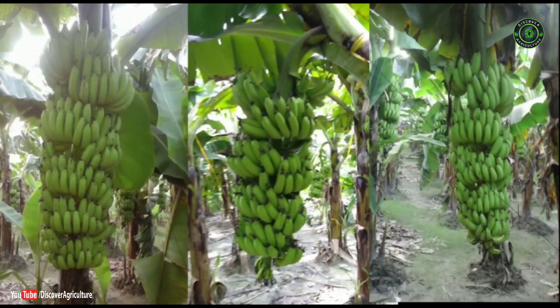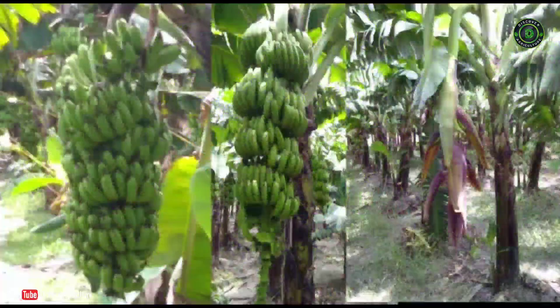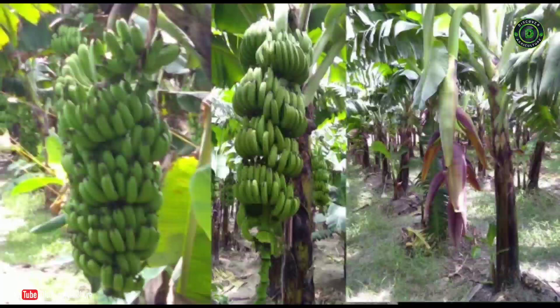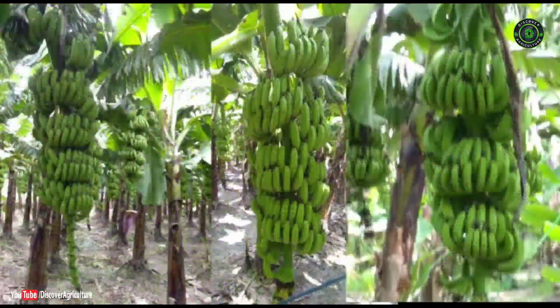By micropropagation, the production of disease-free planting material is possible because the material is free from sucker-borne diseases and pests. The use of healthy planting material complemented with an integrated pest management program is the key to a good crop stand in the field.